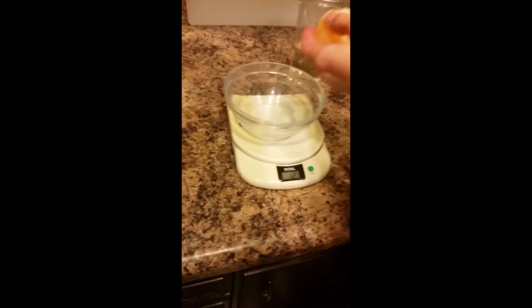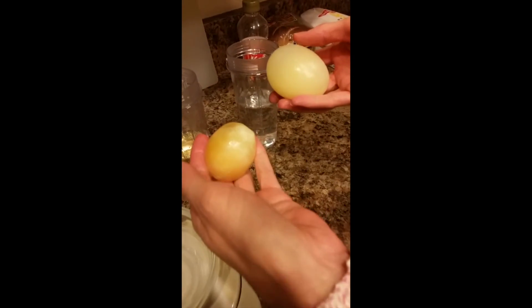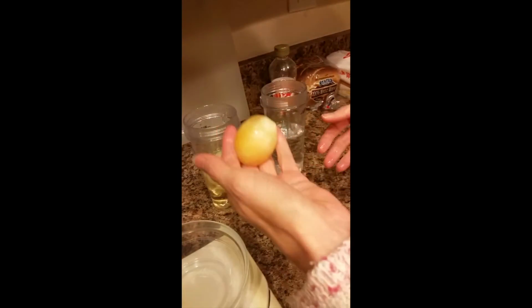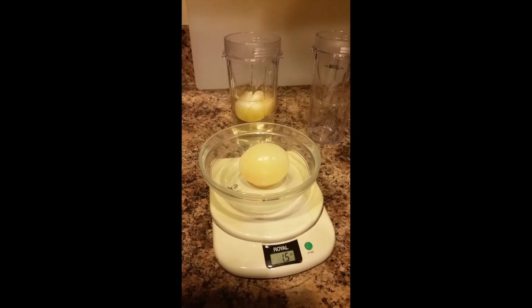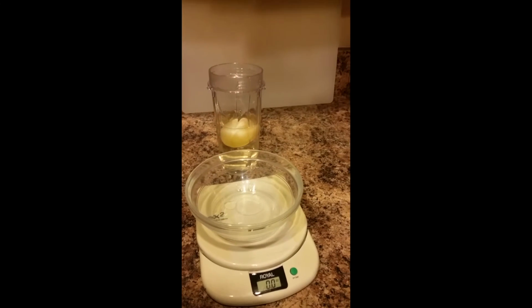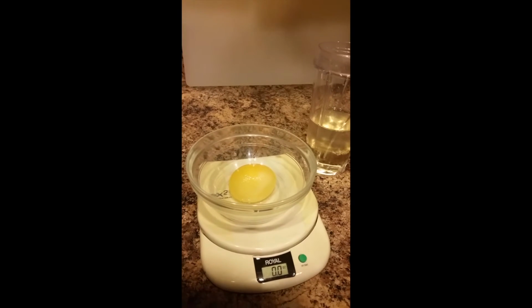To further validate our results and show a more significant change in mass, we'll go ahead and place egg 1 from the hypertonic solution into the hypotonic solution, and egg 2 from the hypotonic solution into the hypertonic solution. Pulling out the eggs, we can see the opposite reactions have now occurred to each egg. Egg 1 had an overall change of mass of 46%. Egg 2 had an overall change in mass of 57%.